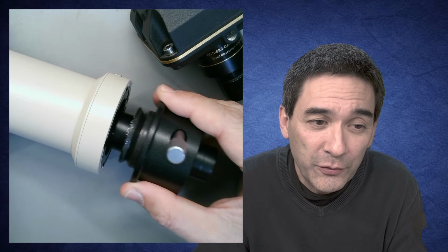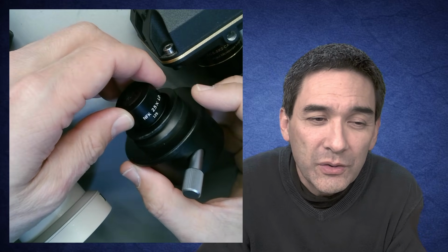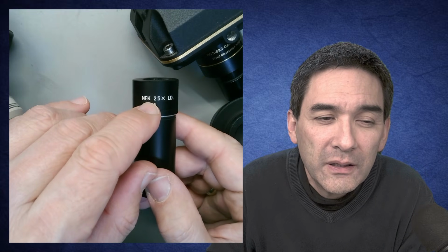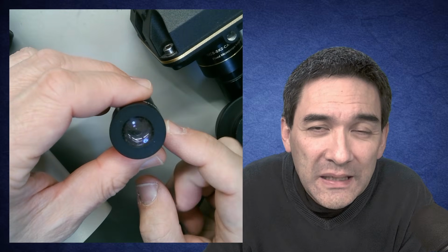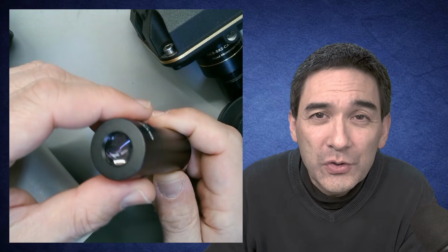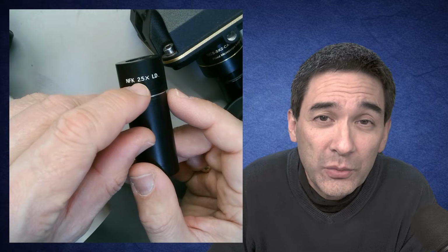Now let's take this one here out first. I already loosened everything. It's also known as the photo projection eyepiece. When you take it out, you're going to see that there is a magnification of 2.5. This is also known as a so-called compensating photo projection ocular. It's a long word. This basically means that all of the lens errors of the microscope objective are compensated and corrected, and it also enlarges the image by 2.5 times.